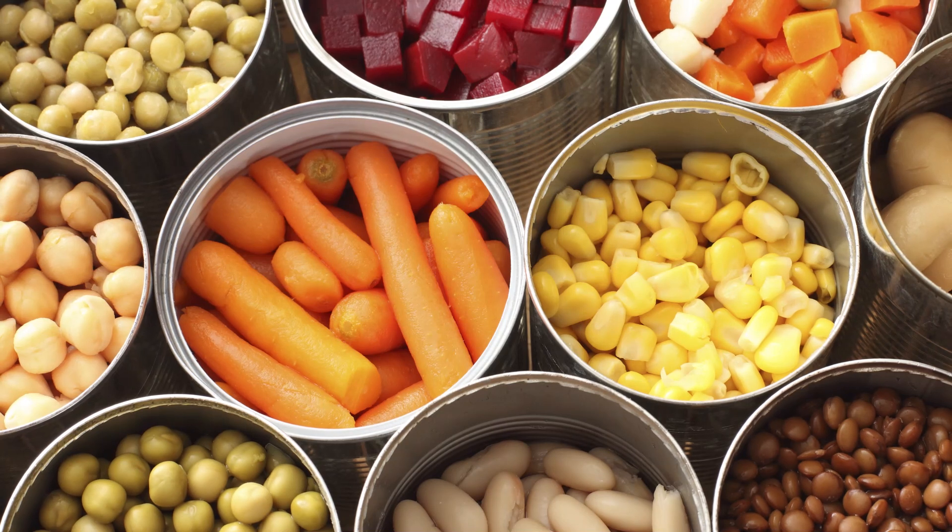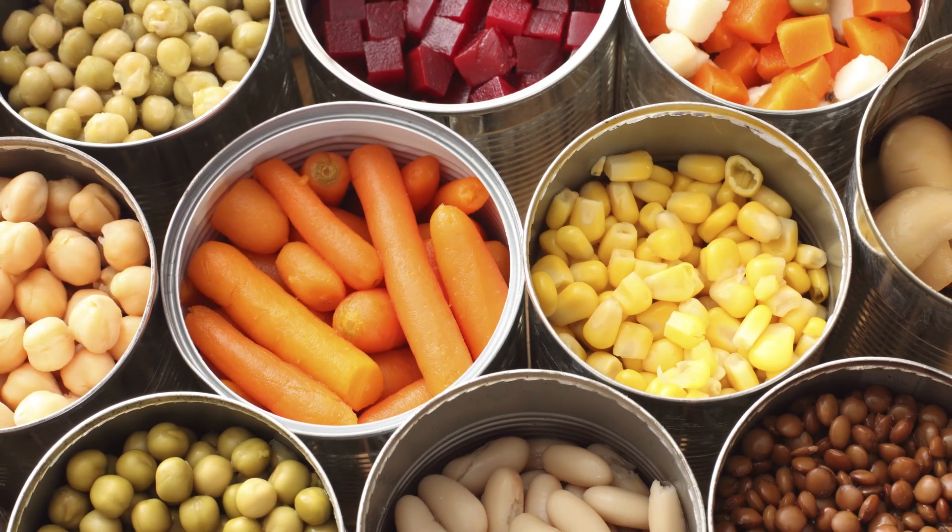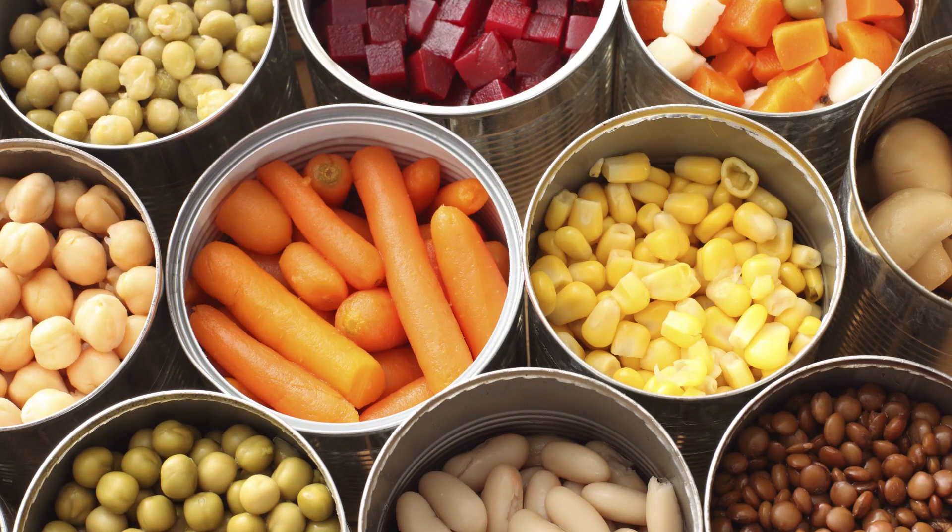These solid foods are required to maintain an equilibrium pH of 4.6 or below as per 21 CFR Part 114 regulations.